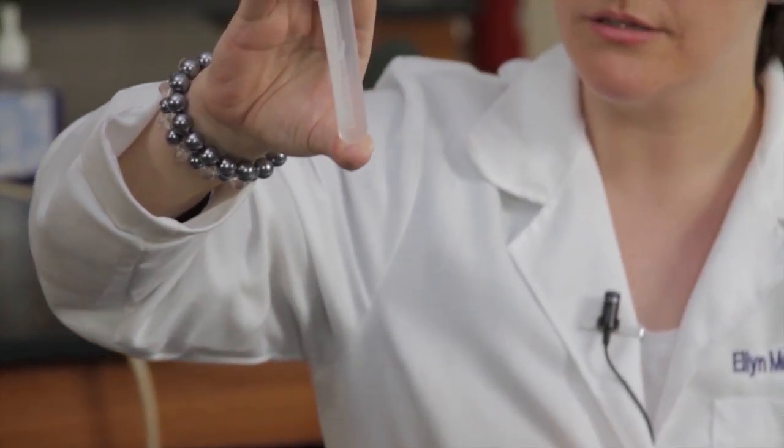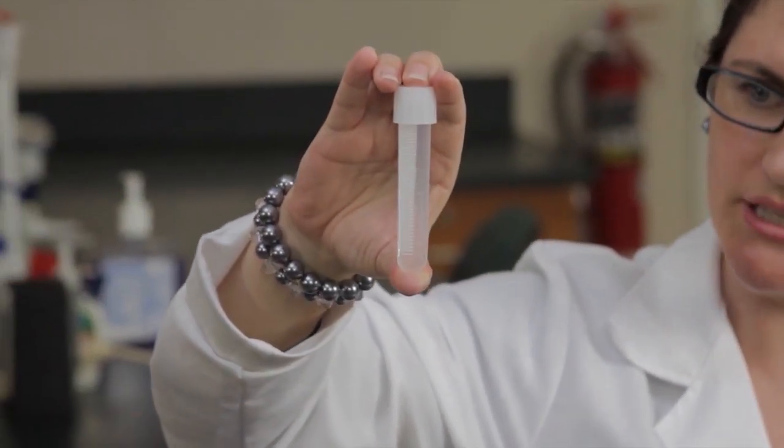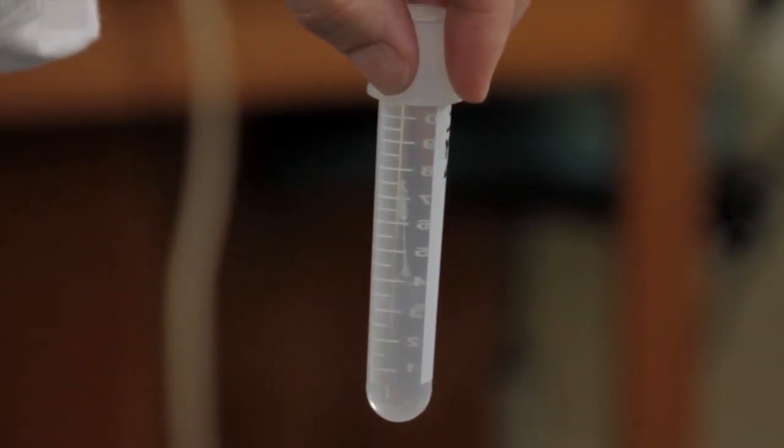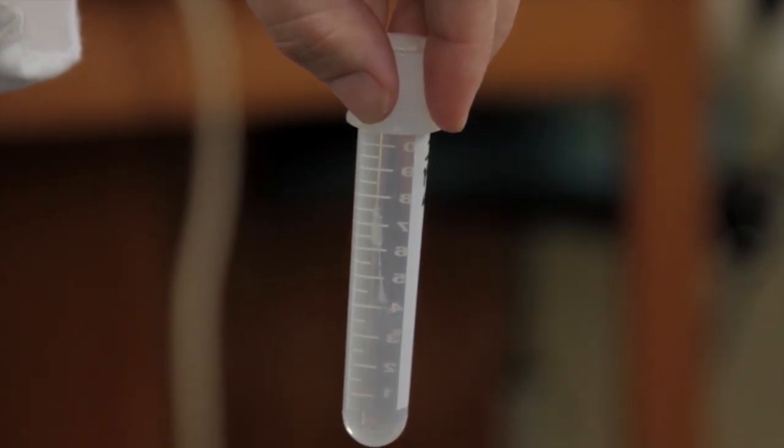So when we stop mixing it, we can see the white strands in our extraction solution. And those long, thin, white strands, that is your DNA.